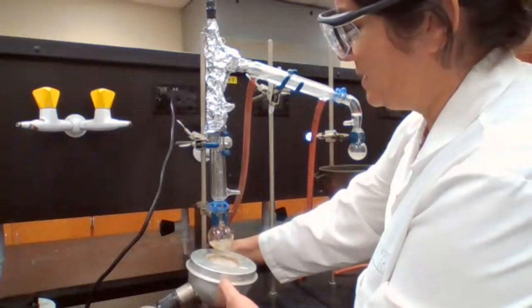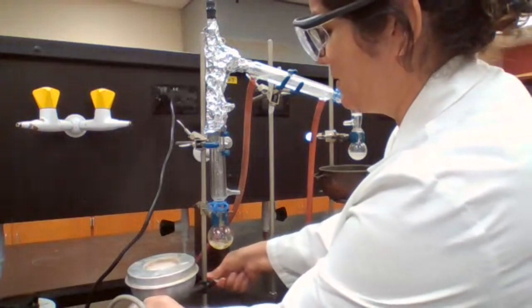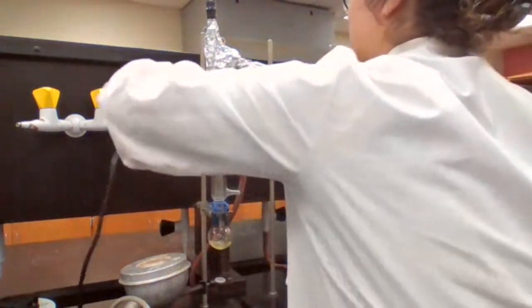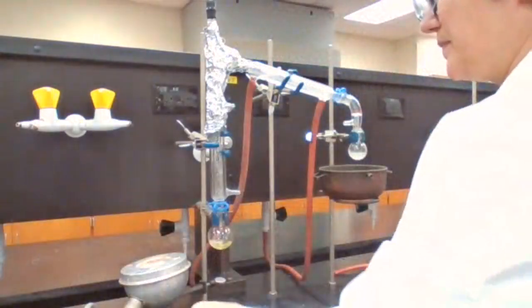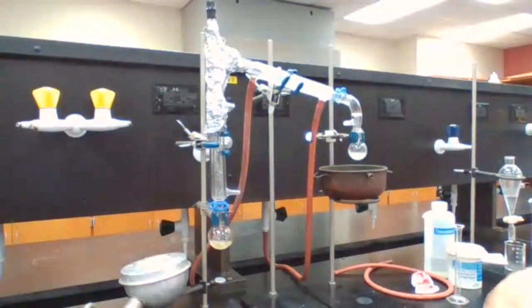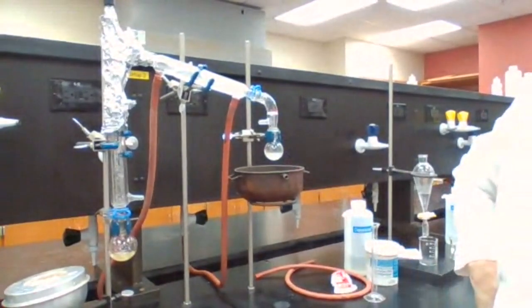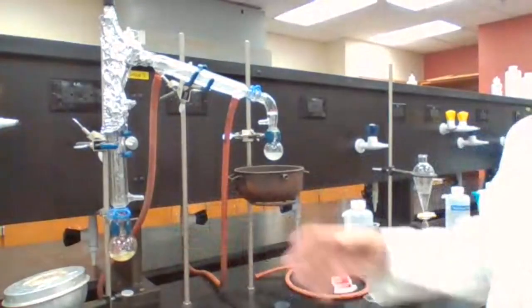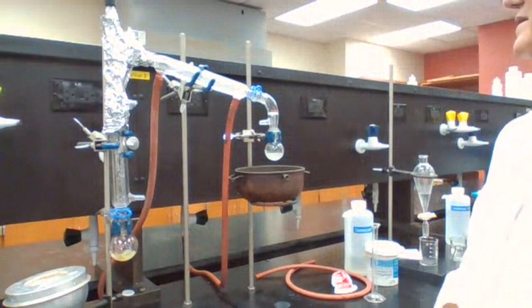As soon as I don't need the heat, I unplug the electronics, so in case there is water splash, there is no damage. Wait for the dripping to stop. You can open it once it slightly cools off, so when I open it, I don't get the vapor of the chemical or the product in my face.